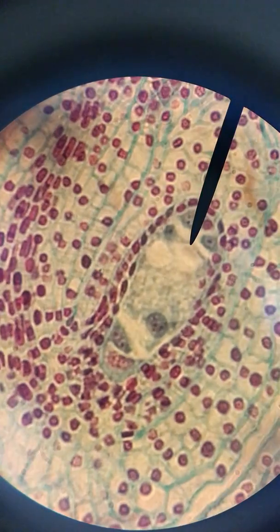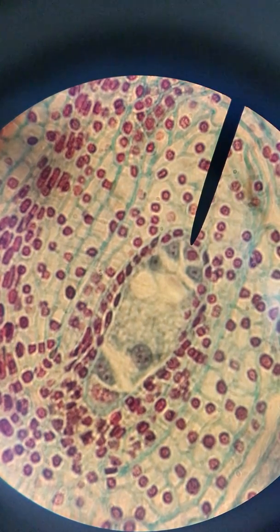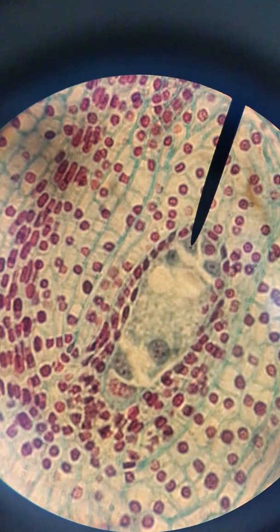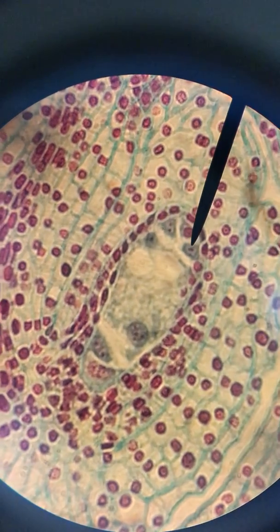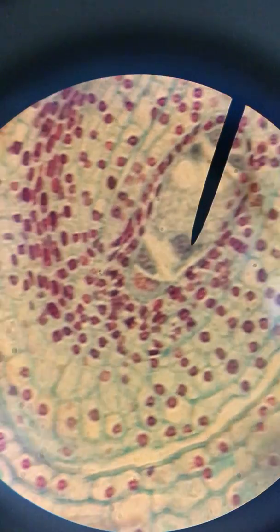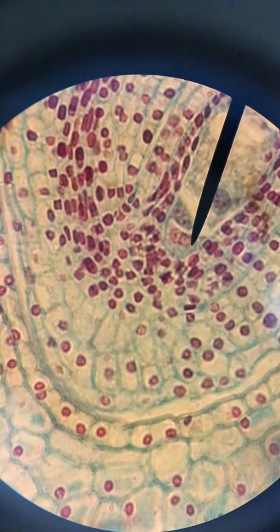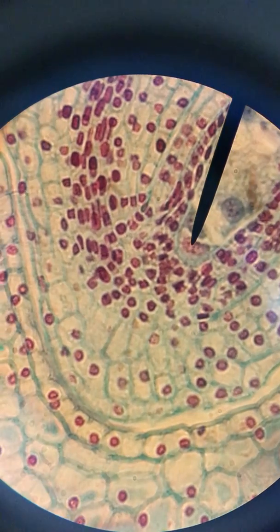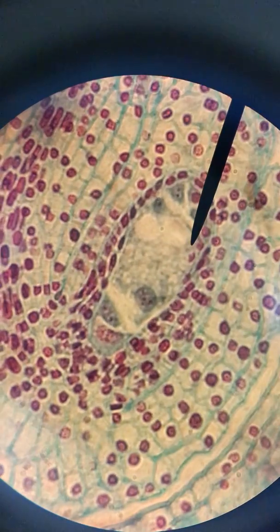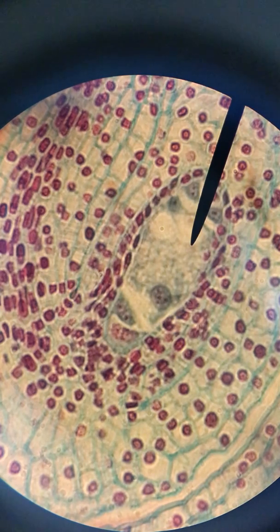Here we are inside the embryo sac. You can see that here we have one, two, three, four, five, six, seven, and possibly an eighth although I'm not sure. We have at least seven of our nuclei within this female gametophyte, the embryo sac.